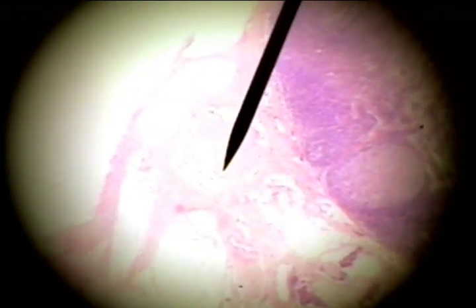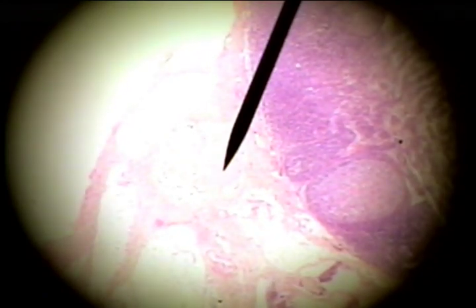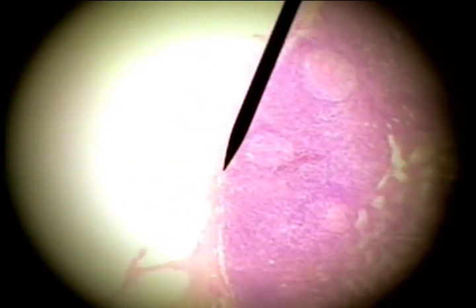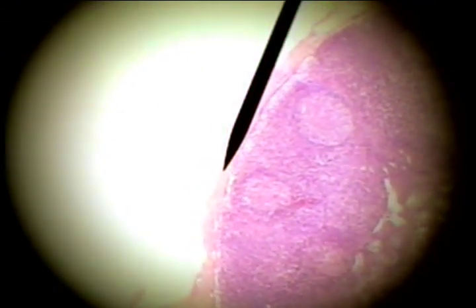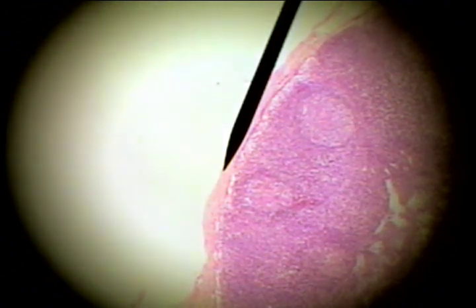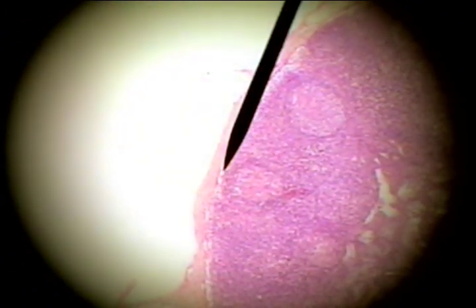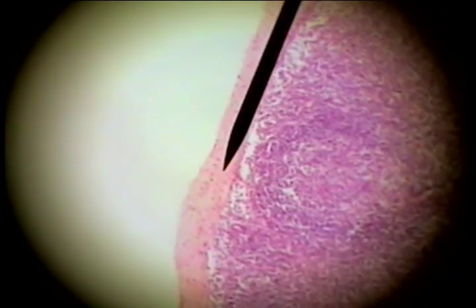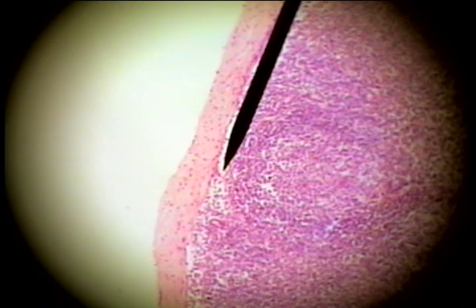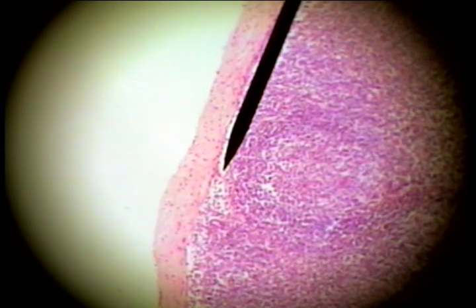It has nerves associated with this organ. The node is surrounded by a dense connective tissue capsule, and immediately under that capsule is a space. Going to 100 power to look at that space, we'll see this is an area where the lymph fluid can circulate.